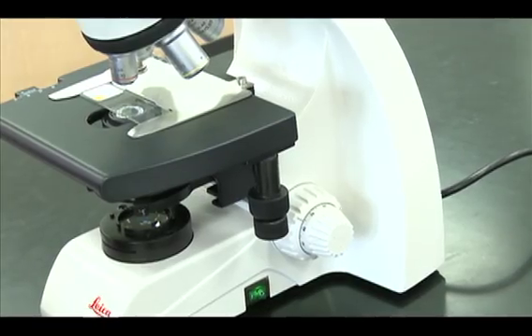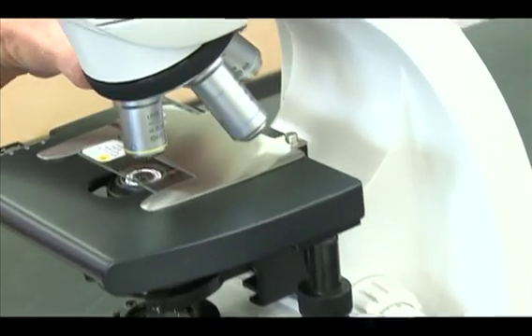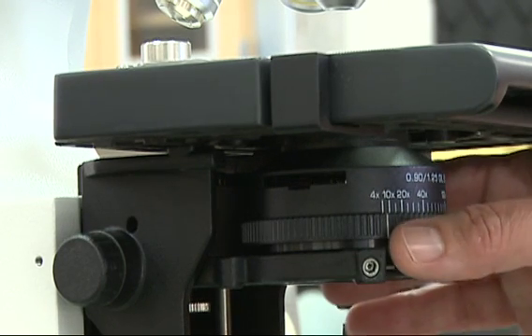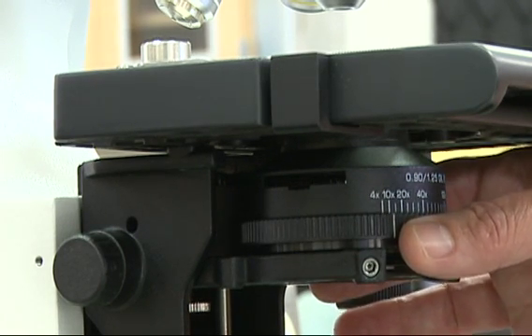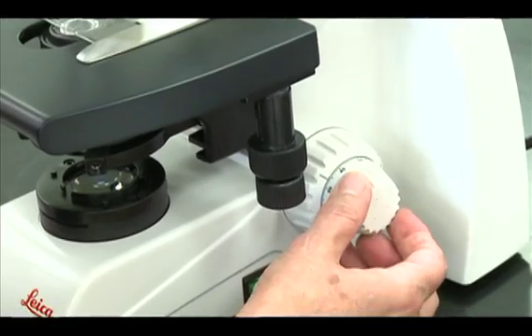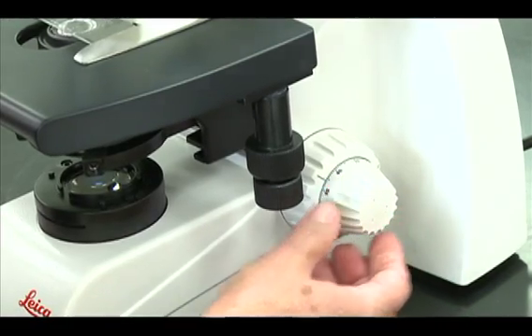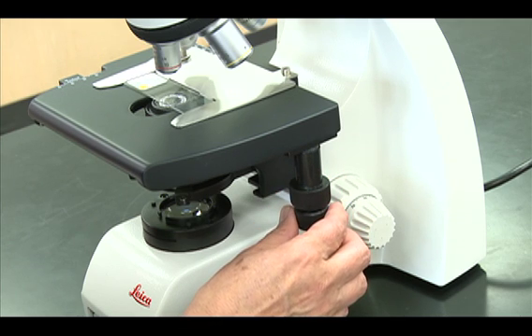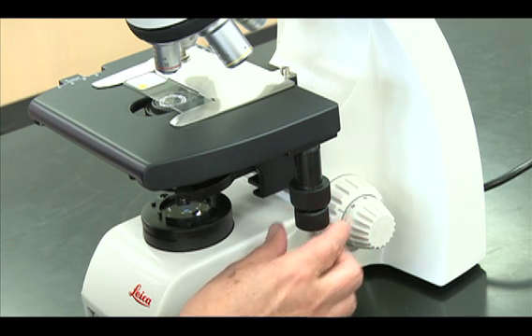Rotate the 10x objective into position and set the iris diaphragm ring to 10x. Focus with the fine adjustment knob only and scan your slide.